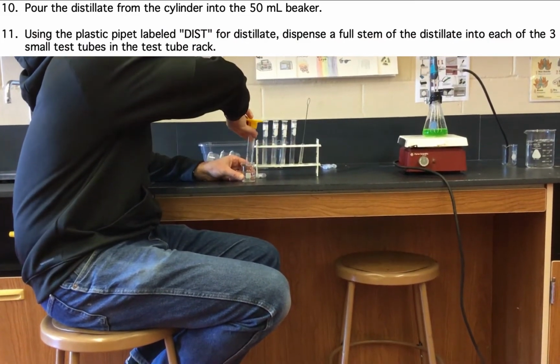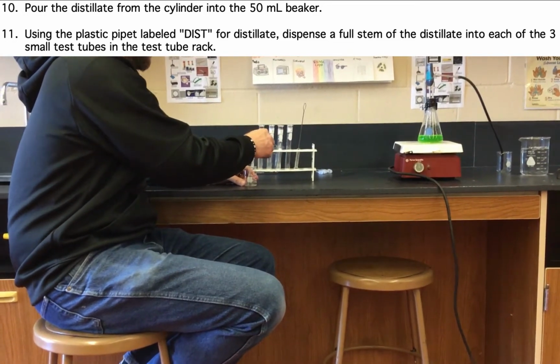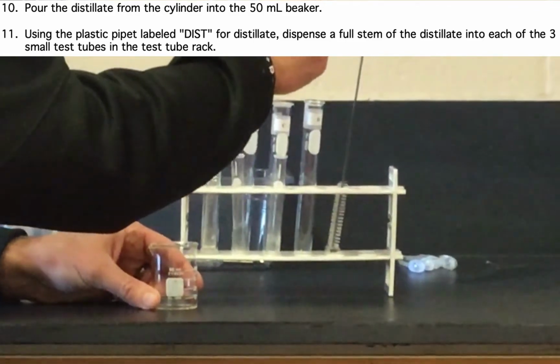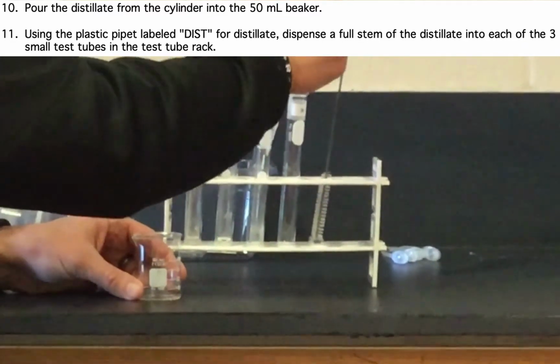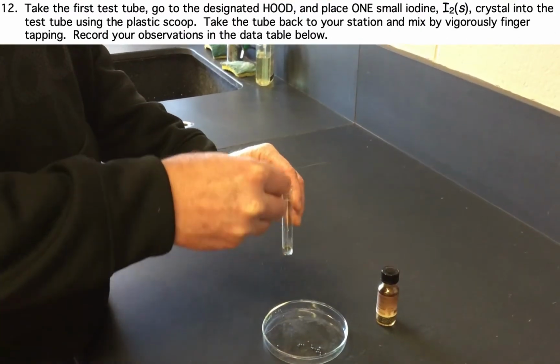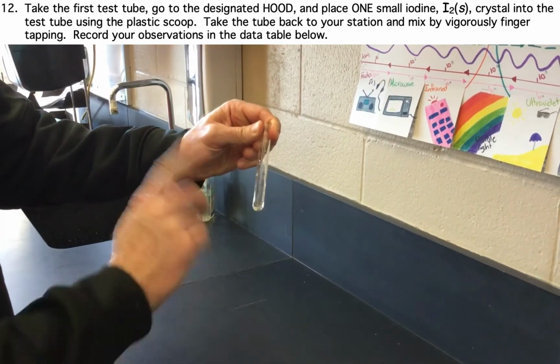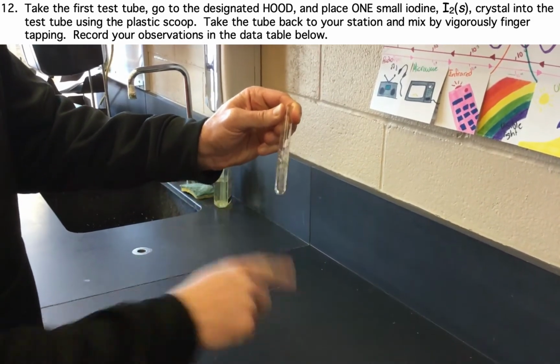We will now do some tests on the distillate to help us determine the identity of the distillate. First, we will add a crystal of iodine to a sample of the distillate, finger tap, and then make observations. Record these observations in the data table on page 2.